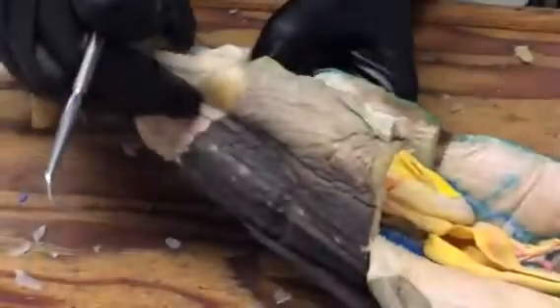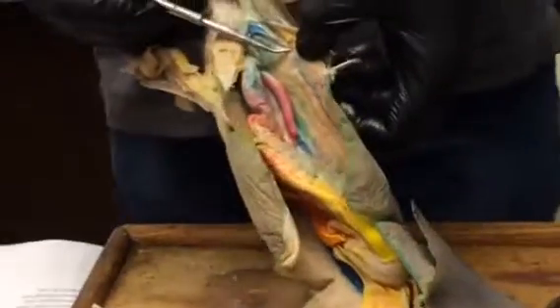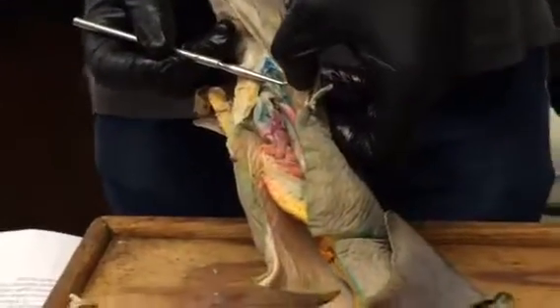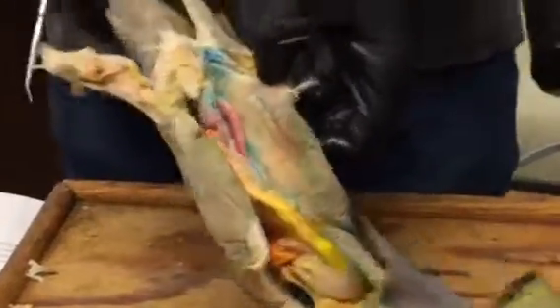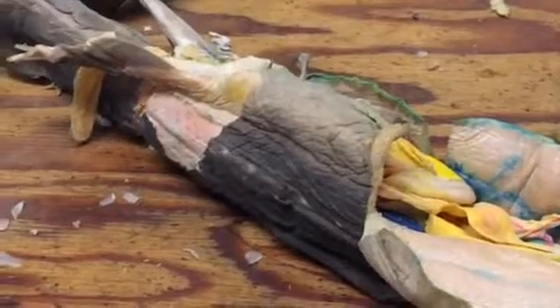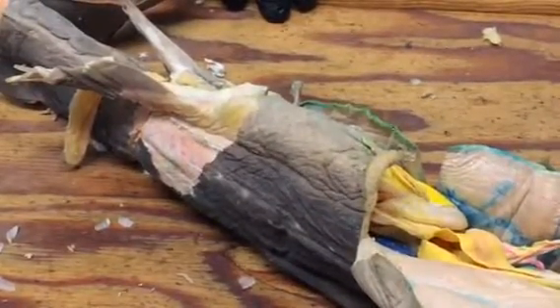And can I see it? If I could see red. Is that red at all in there? Yeah. Okay, well, good, because that's where it should be, but I'm just always not sure of red. That would be the posterior ventrolateral artery. And again, that's not a major one for us, so you don't want to stress on it.